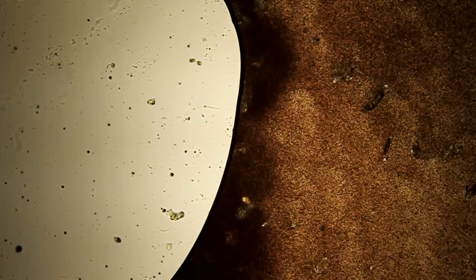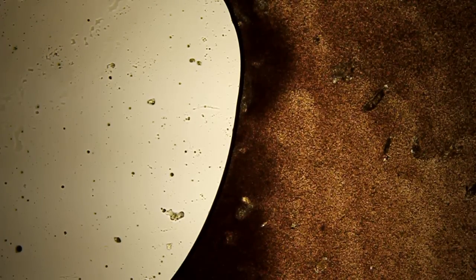What we have here is mouse blood. He was caught about 15 minutes ago in a trap. I took a sample with a pipette, put it on a slide and used the cover glass to get a smear.